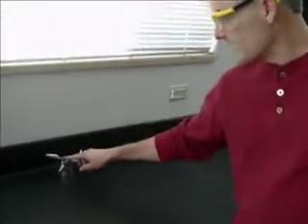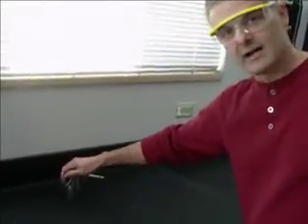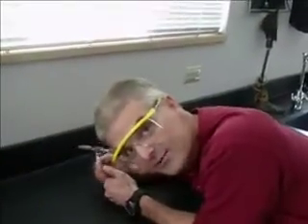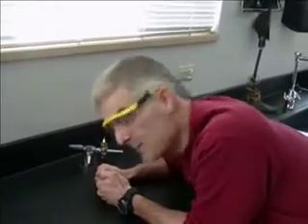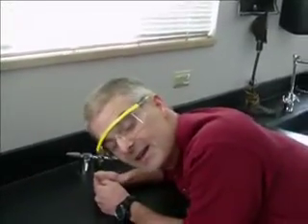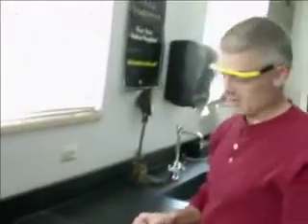All right, I happen to have a gas jet right here, and this has natural gas, or methane gas, coming out of it. I can turn the gas on, and I don't know if you can hear, but it's now hissing. What the student did is he had a lighter. He was a smoker, and he said, Mr. Bergman, what would happen if I did this? And he had his face right in front of the gas jet with his lighter. Well, I'm not going to put my face right in front of it as that student did. Luckily, I screamed loud enough that he did not do what I'm about to do. So we're going to do this on a much safer basis.